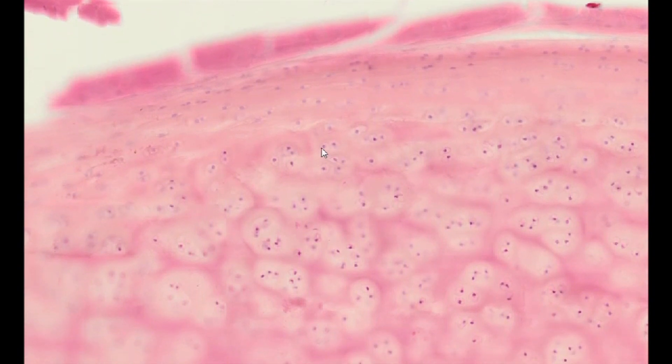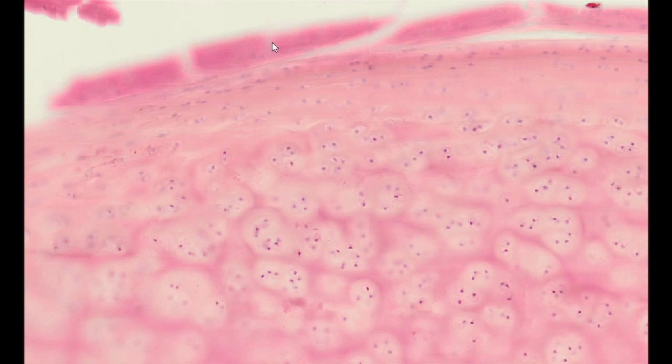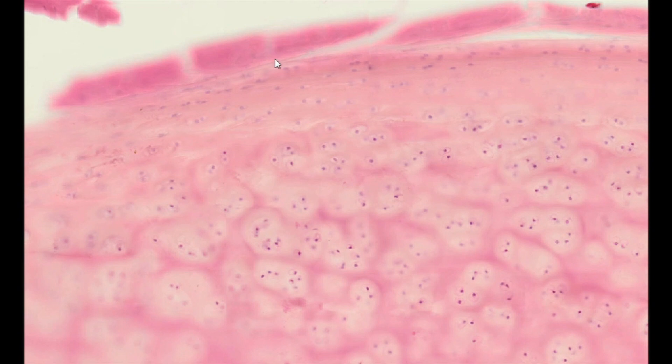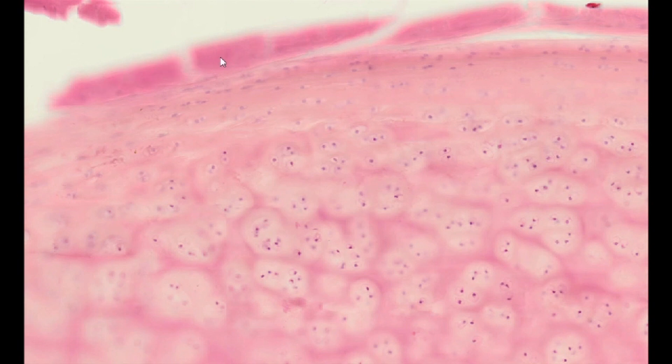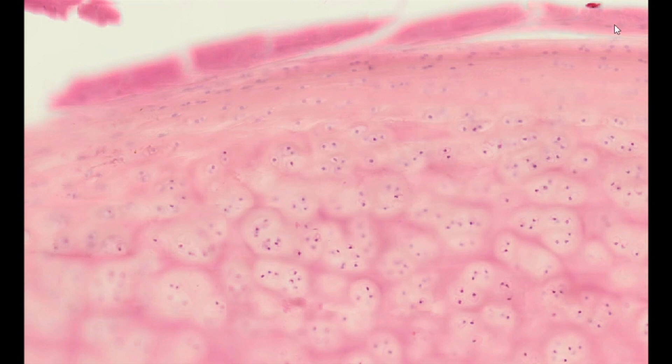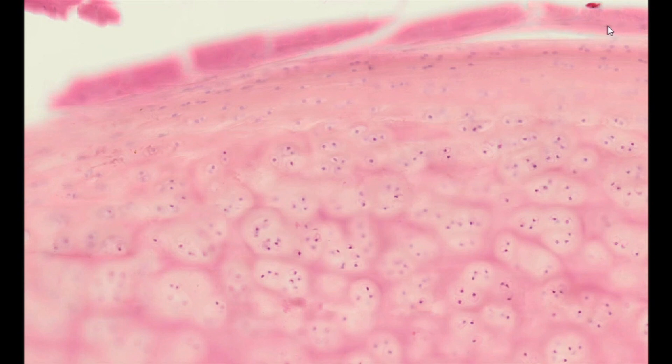The perichondrium is visible in the peripheral area of the cartilage as a clearly eosinophilic layer. It consists of two histologically different layers. The outermost layer of the perichondrium is a fibrous layer, composed mainly of parallel collagen type 1 fibers, and single flat fibroblast cells lying between the fibers.